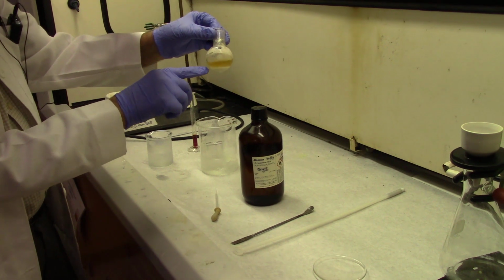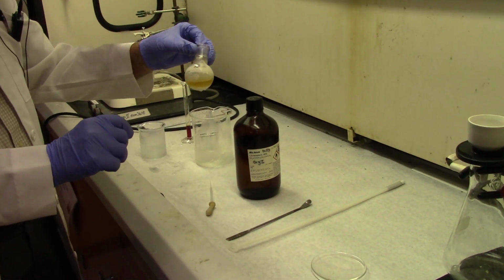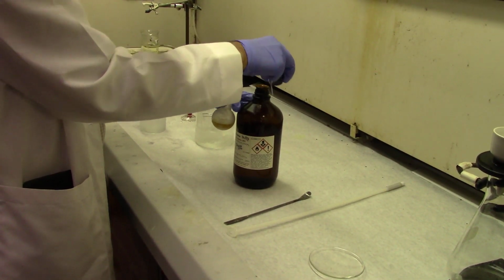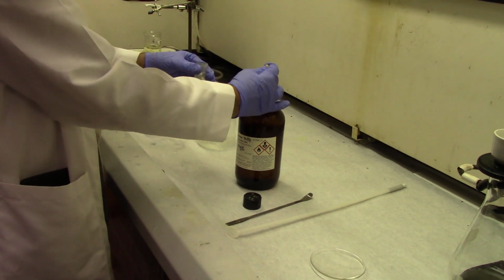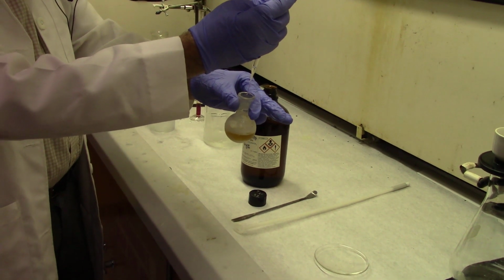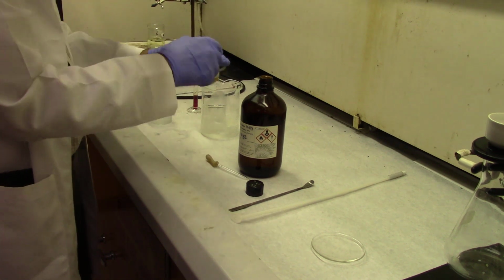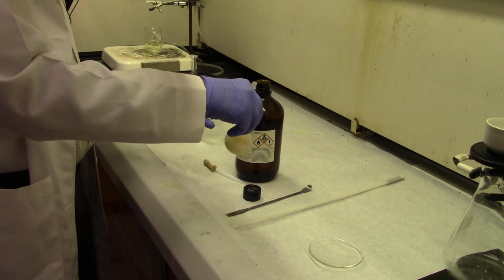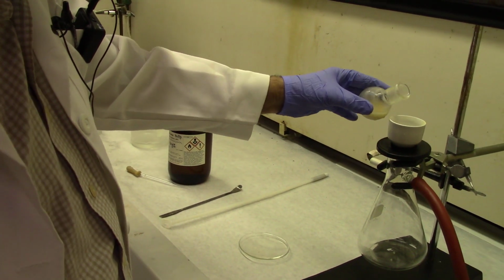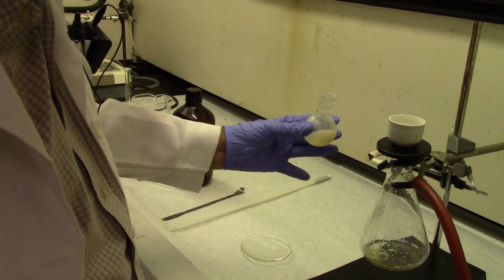So it has been cooled for about 5 minutes, and we have gotten some more precipitate. You can see it's still orange, which tells us that there's some excess bromine in there. We need to kill off that bromine with a couple of drops of some compound that has double bonds. Right now we are using 1,5-hexadiene. 1,5-hexadiene is a little bit smelly, so when you're using it, be aware of the smell.